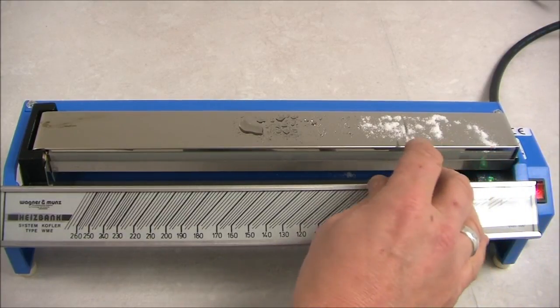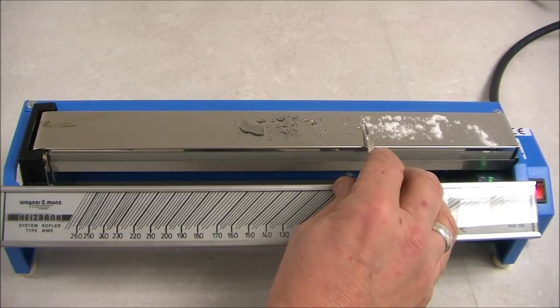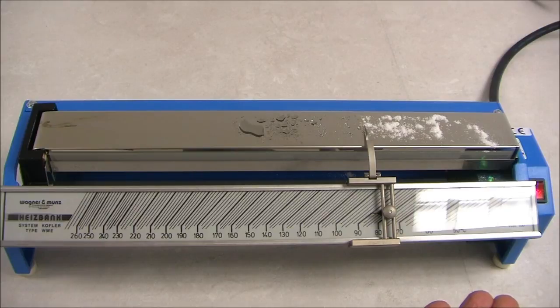But if we move the indicator along to the point where the substance starts to melt, it's actually there. We can read the temperature off. It's just as simple as that.